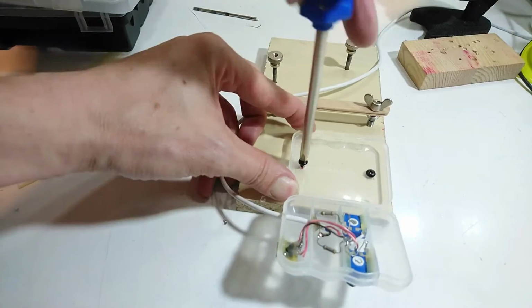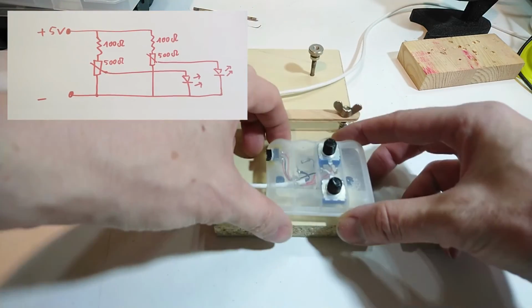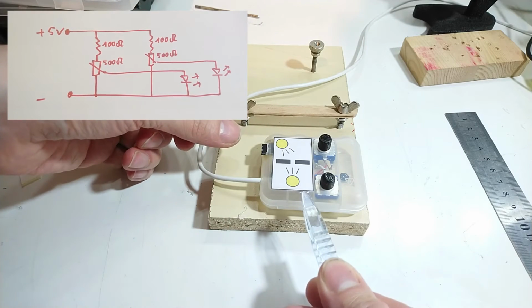The lamps are plugged into a simple control box that gets its power via another USB. The box has two knobs to regulate the brightness of the lower and upper light.